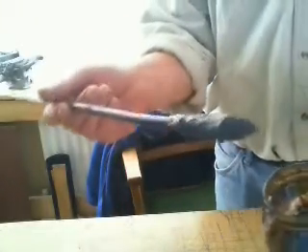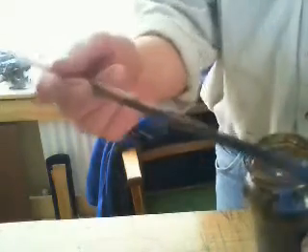After you've done that, it turns into this really thick paste. This brown along the rod, incidentally, is the graphene oxide that we're actually after. What we're going to do now is add 230 millilitres of distilled water, back in the water bath at 45 degrees, and stir it for half an hour. Once you've done that, it turns this kind of muddy brown cola colour — this is pretty hopeful because that's what it's supposed to look like. Once you've done that, you need to kill the reaction by adding 600 millilitres of distilled water with 150 millilitres of the 9% hydrogen peroxide added in. You add that in and that's the end of the reaction.